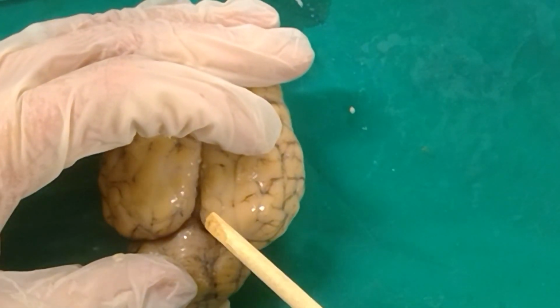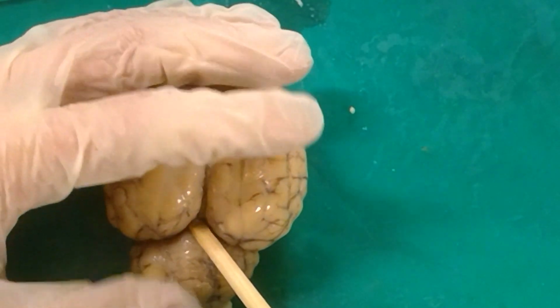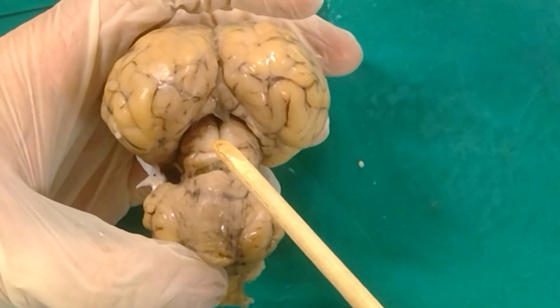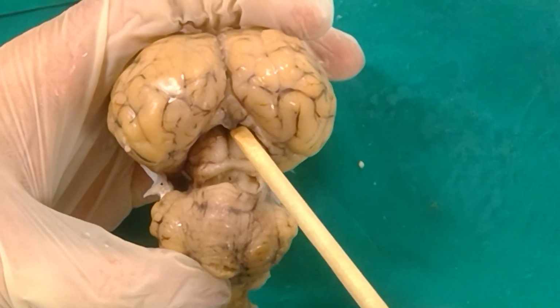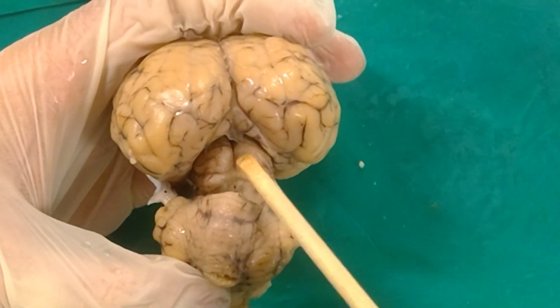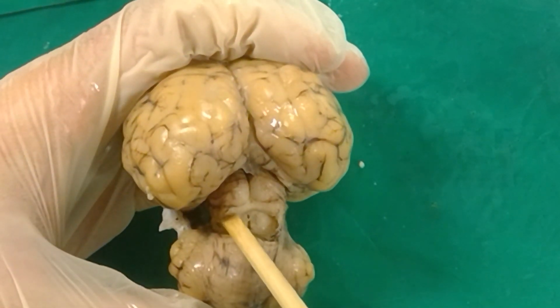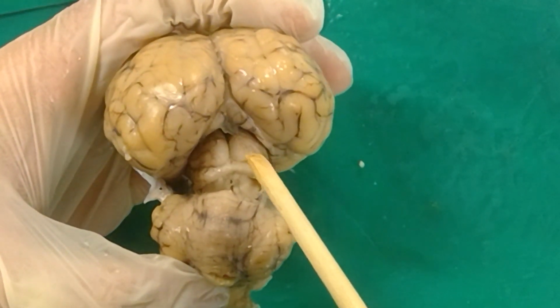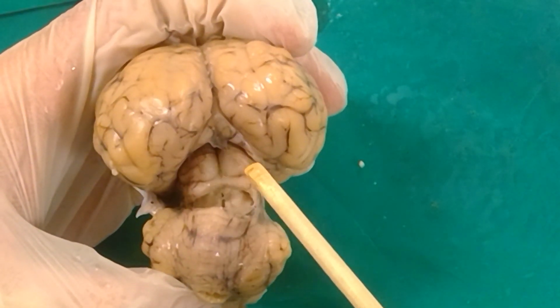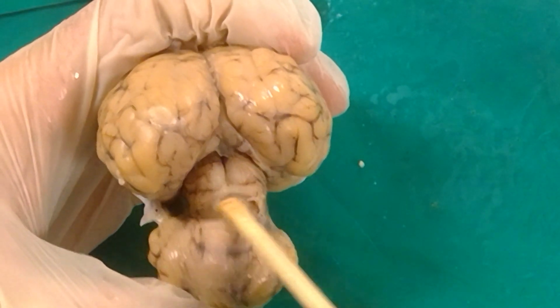And if we look up here, the space outside the brain between the cerebrum and the cerebellum, this space right here is known as the superior cistern. If we pull this back and look underneath here, we can see two large bulgy masses. This is the superior colliculus, these two things. Superior colliculus, superior colliculus. Just below that, these that are smushed out to the side, this is the inferior colliculus. We've got one right here, one right over here. I don't know why the superior colliculus is so large in sheep compared to their inferior colliculus, because honestly, it's not like they have that much better visual reflexes, but we have a huge superior colliculus relative to their kind of tiny inferior colliculus on each side.